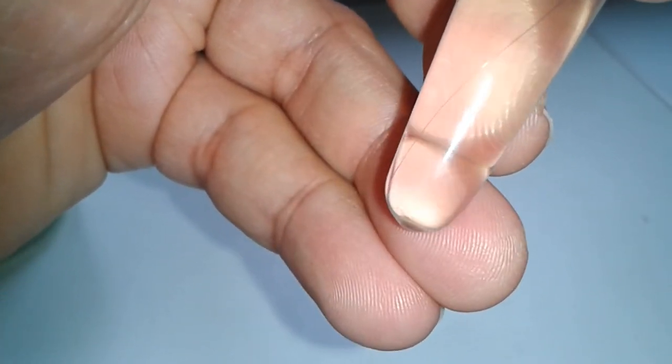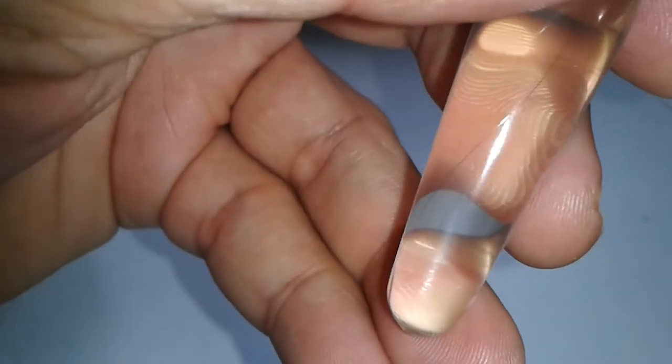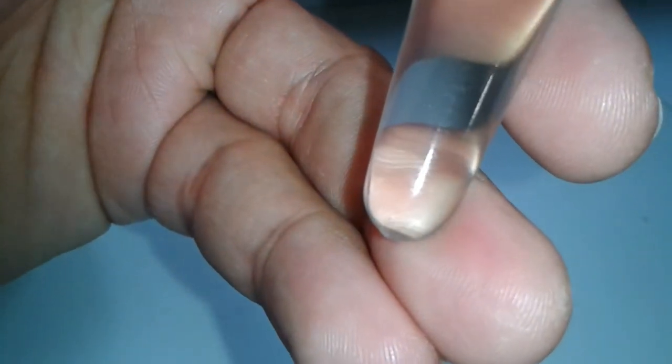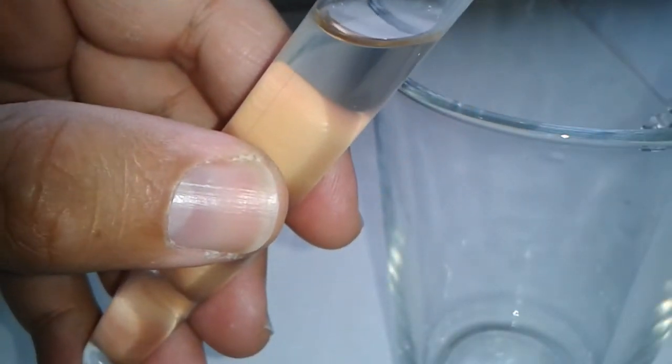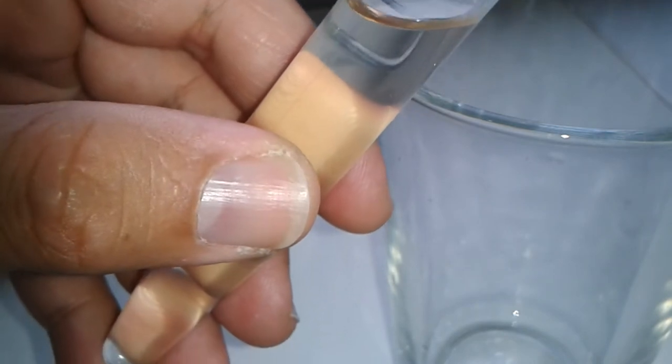And then after a few minutes, you can see there's unfortunately a small crack in the tube. So that's not a good thing because it's dangerous, it might break. But then basically all of the pollen or most of them have collected at the very bottom.